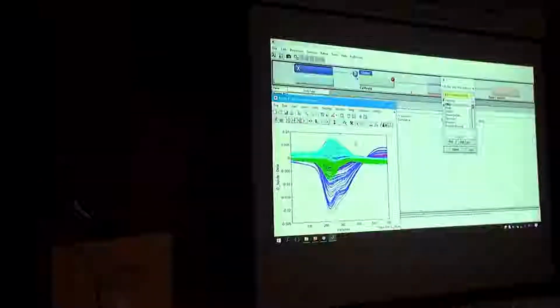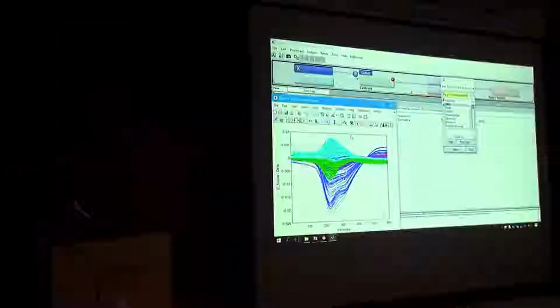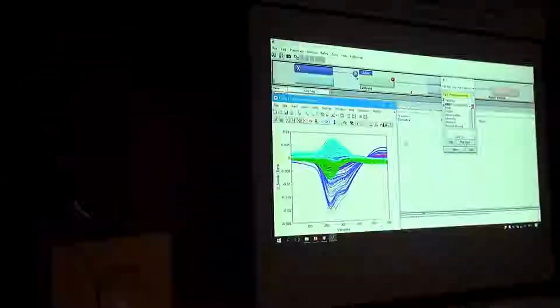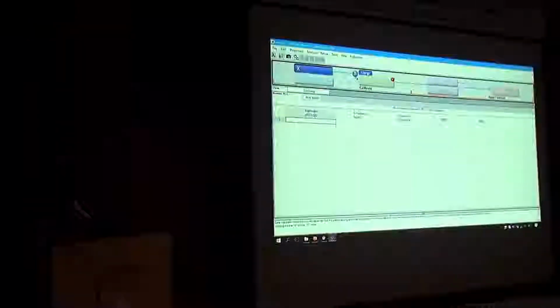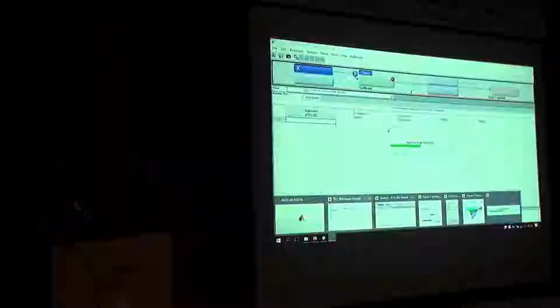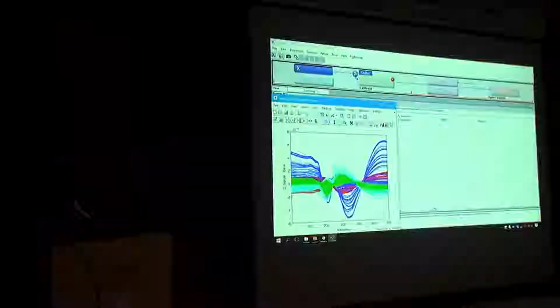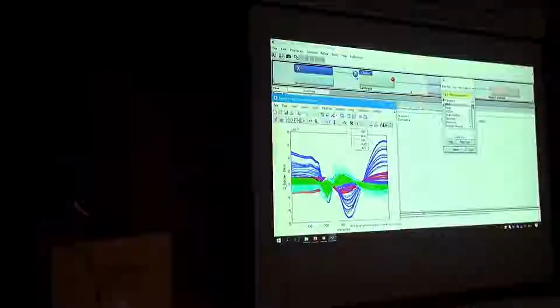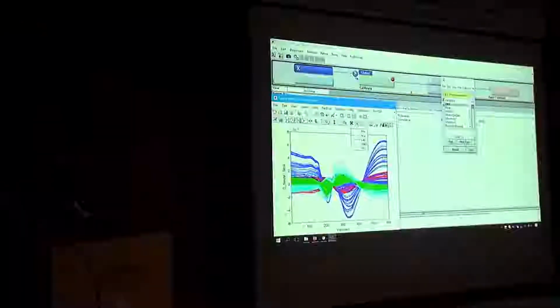So you can see already even the shift in the temperature is gone. So the spectra are aligned. The direction in which the temperature shift is working, which is kind of orthogonal to the rest of the information, is subtracted. Let's add 2. If you have two screens, this could be useful, because information is coming out. Temperature shift is gone, but you see the difference between solutes is even more clear. And you can even see that there's a concentration gradient appearing that's hidden in the spectra.